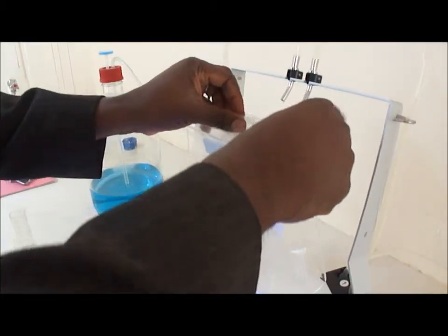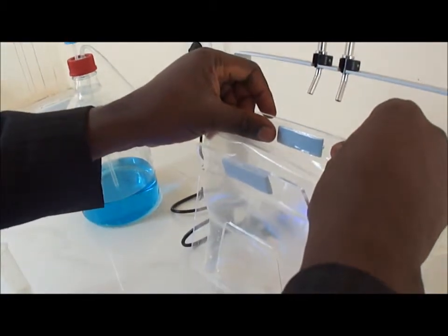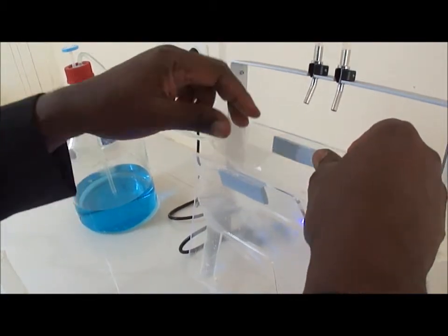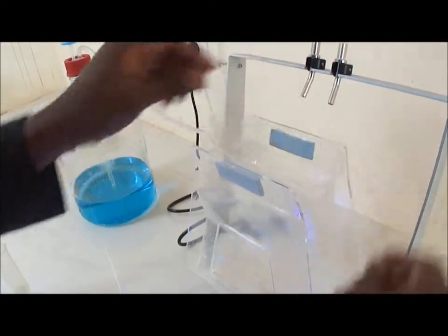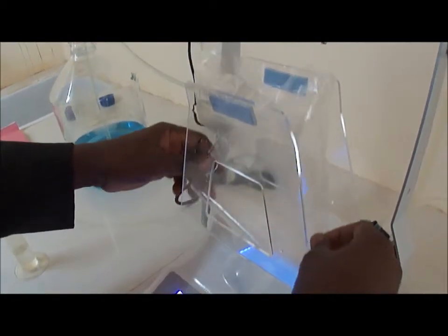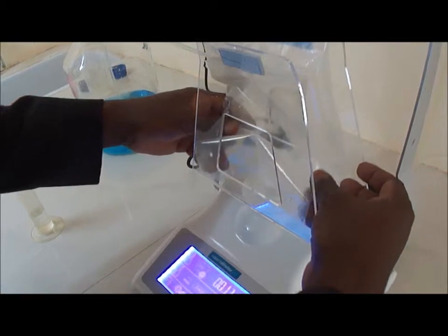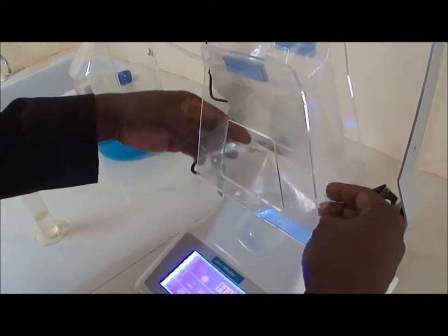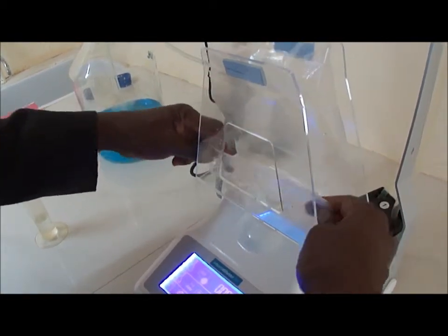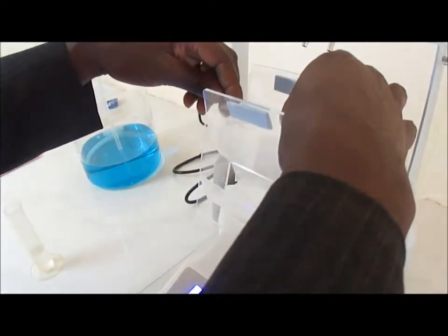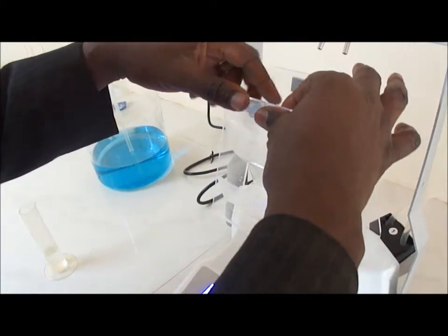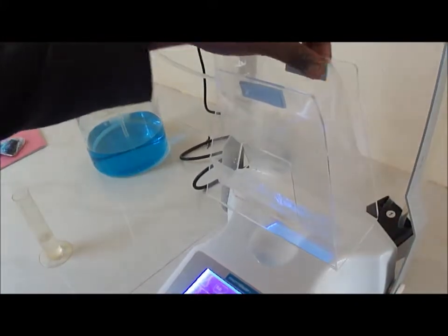Now, we make the tare of the plastic bags that will receive your sample. If the sample is, for example, a soil sample, you can introduce, as we saw it at the beginning, solid elements and make your dispensing or dilution with them.